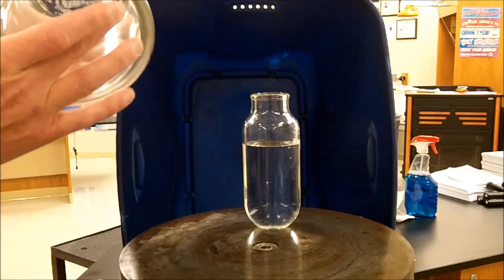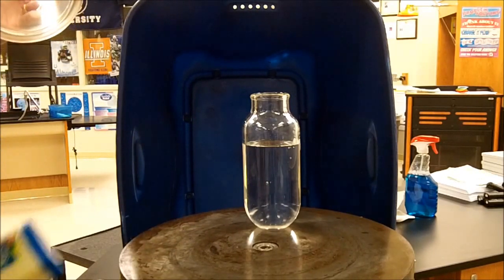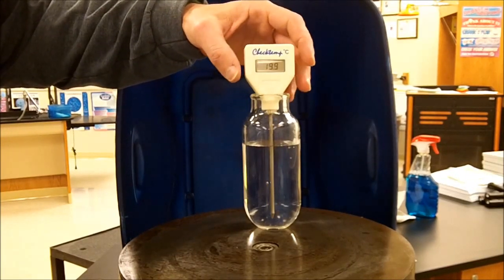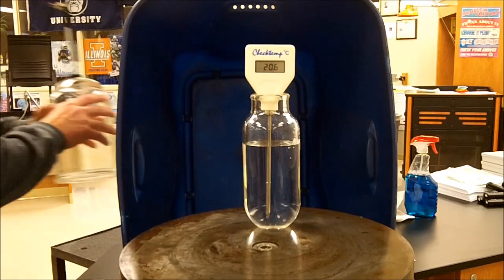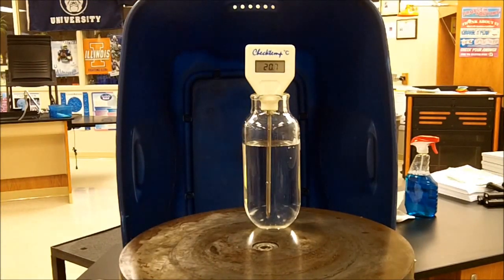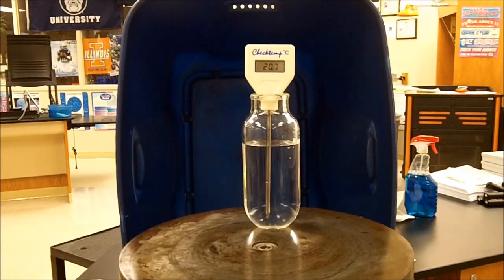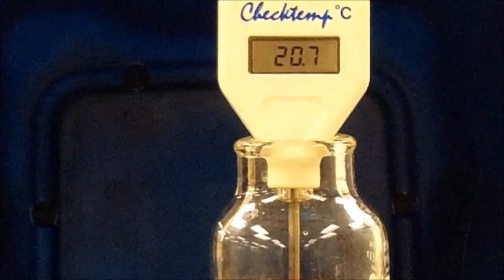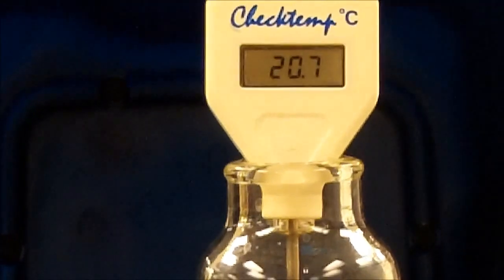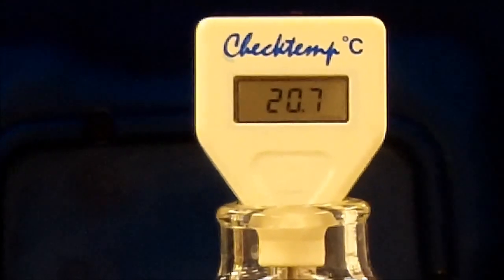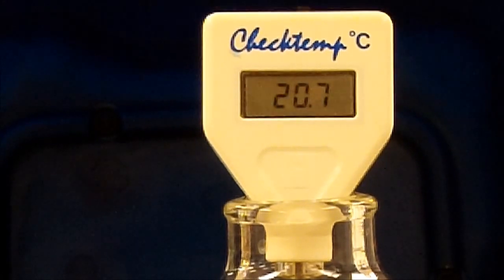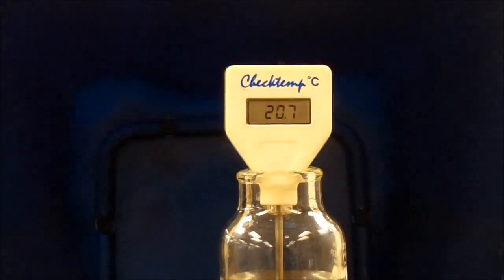I need to seal the bottom of the bell jar. Now I'm going to place some good old fashioned petroleum jelly on that. But before I do that, let me put the thermometer in here so you can get a reading of the temperature here. And let me zoom in on that just to get what the temperature is right now. So the temperature at this moment is at a balmy 20.7 degrees Celsius. So everybody should be able to see that. 20.7 degrees Celsius, which is pretty typical for room temperature. And that's about 70 degrees Fahrenheit-ish.